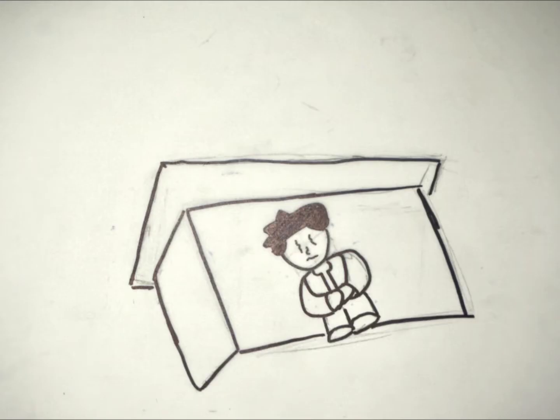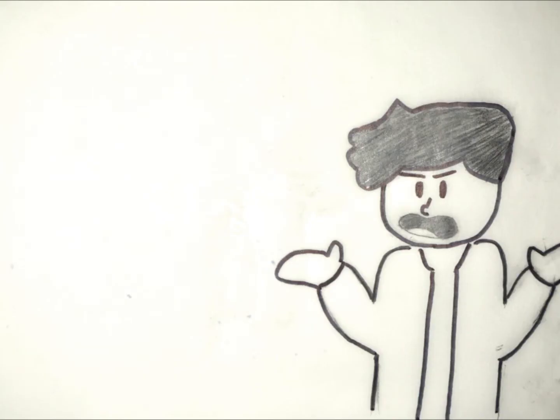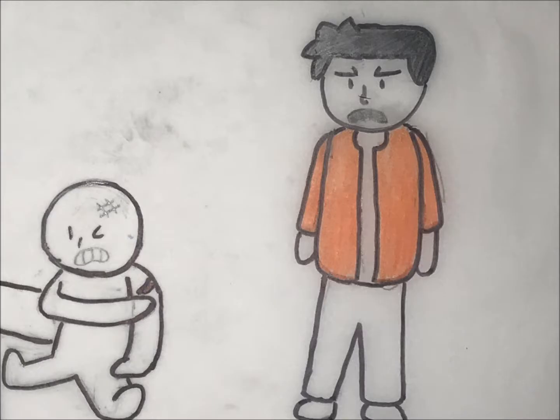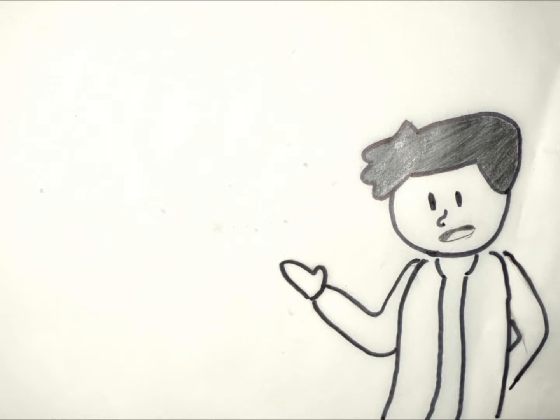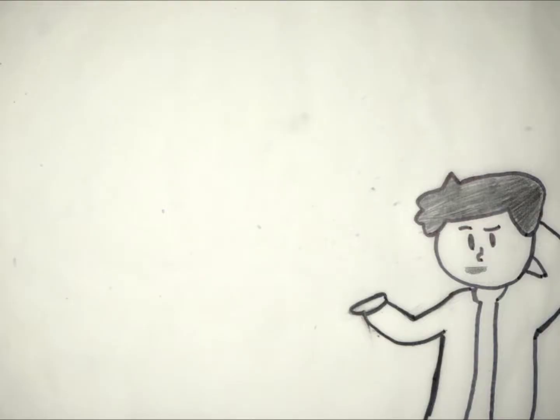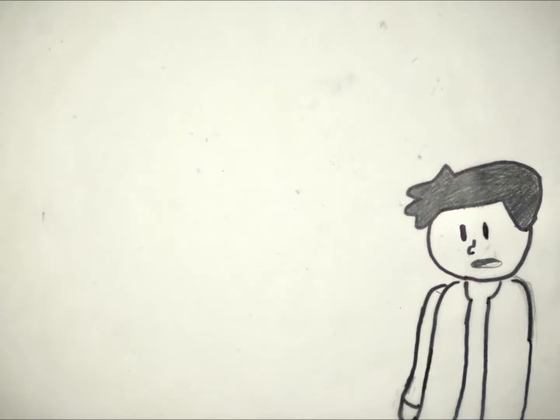Before they had dropped the match, I ducked like every other experiment they had done, but when I heard the loud pop, I stood up and I saw there were glass shards scattered absolutely everywhere, some of them actually reaching my group's work area. At first, I stood shocked and looked around because there were students that got injured, and one of them even had a huge gash in their leg. After a good minute of processing the situation, I bolted to get some wet paper towels for the injured students. In retrospect, maybe I shouldn't have ran immediately after because it might have looked like I'd done it. The area was closed off by medics, so I just decided to head home.